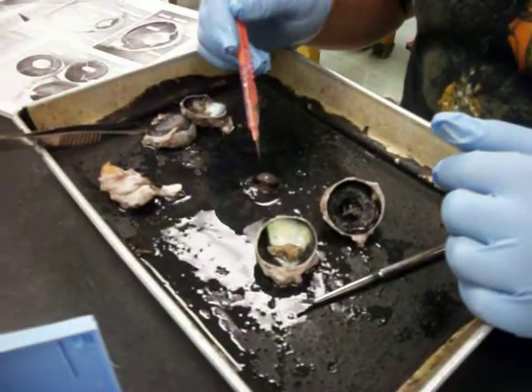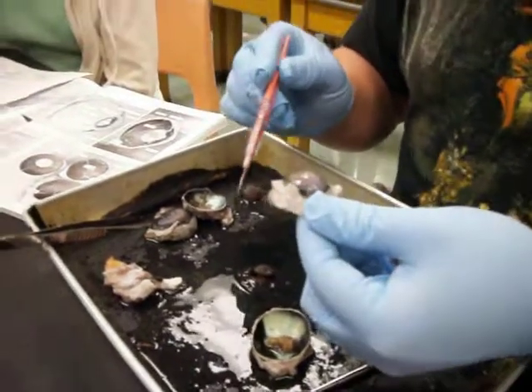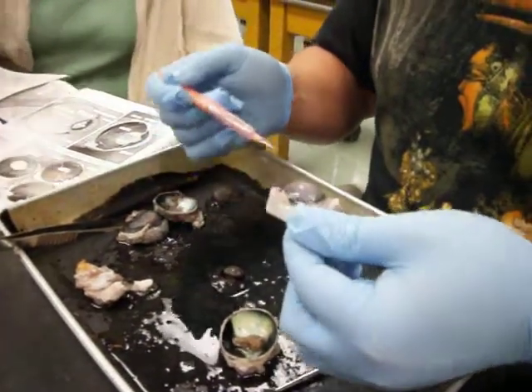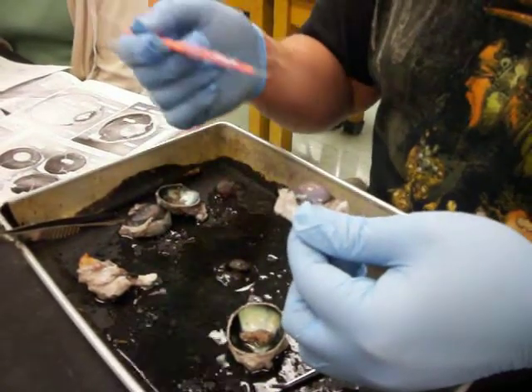Okay, cornea, outside of the front of the eye. So I'm guessing that would be somewhere around here, or maybe it's here. Yeah, it's like the lens of the outside. Okay, so it's the lens of the outside. Alright, so that's the cornea.